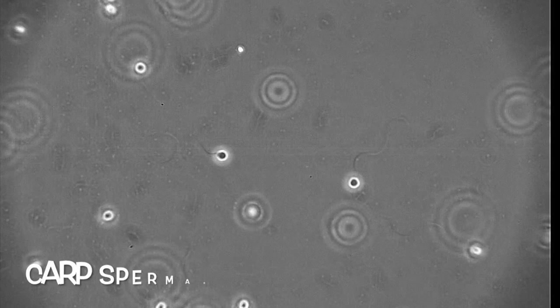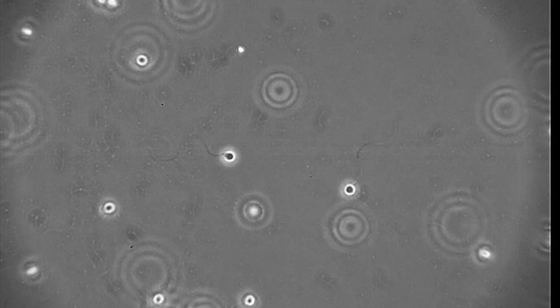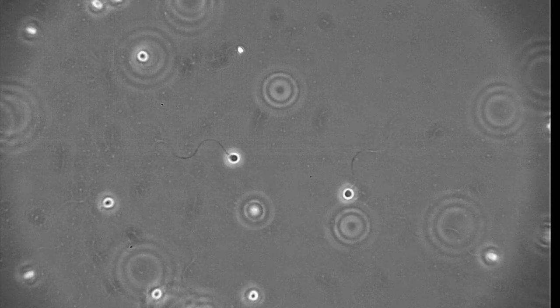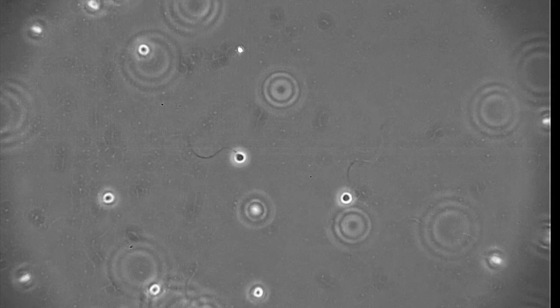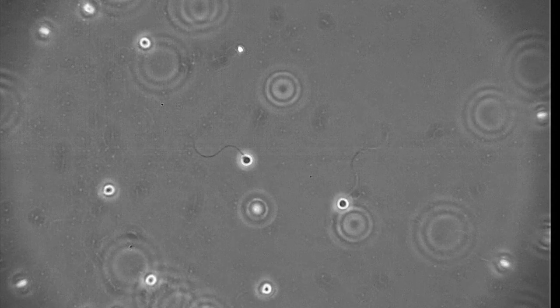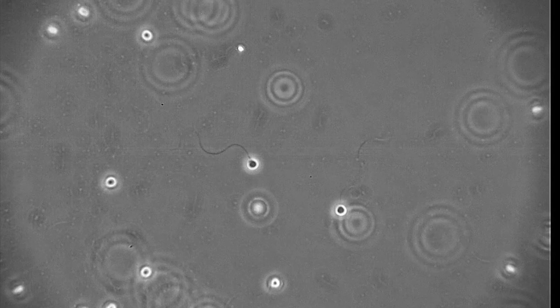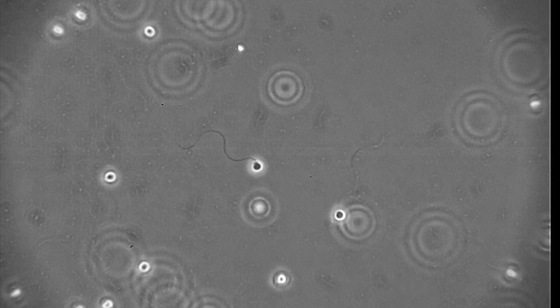In this clip we can see the movement of swimming flagellar sperm in different fish species. First we see a population of carp spermatozoa recorded by high speed camera and visualized about 20 times slower than normal speed.